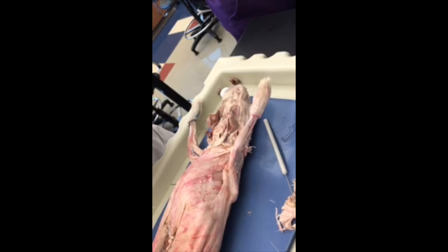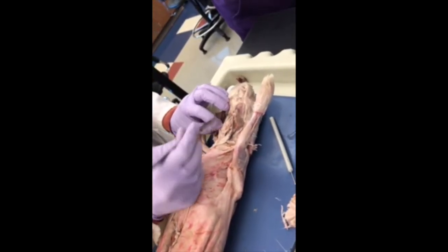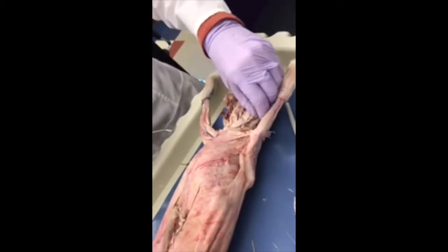Oh, I just cut myself. That's going to suck. There we go. Okay. I see everything now, which is great.